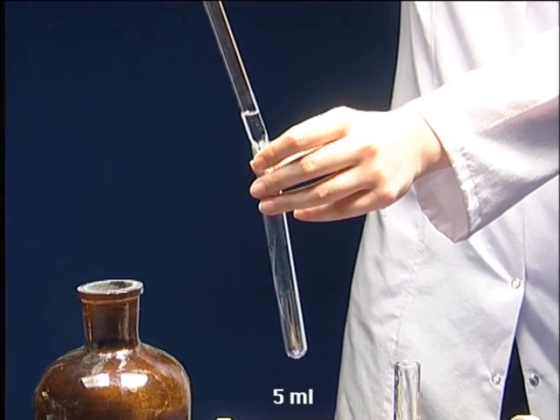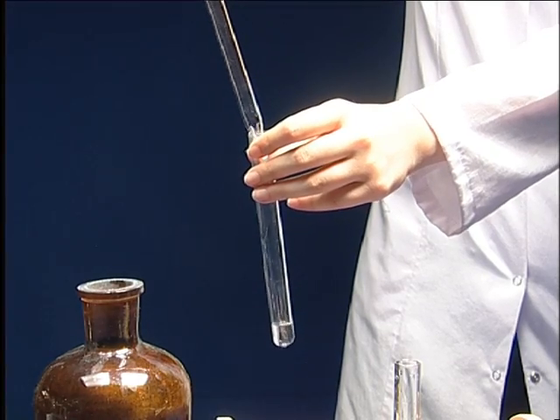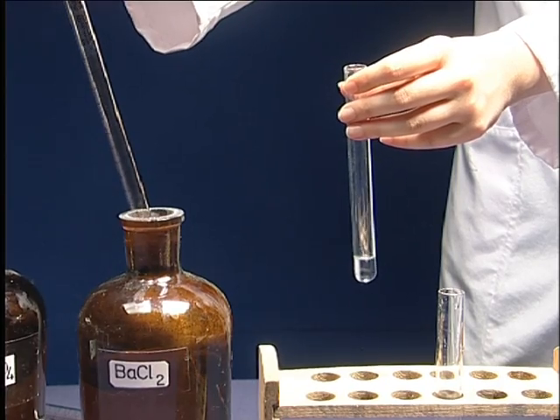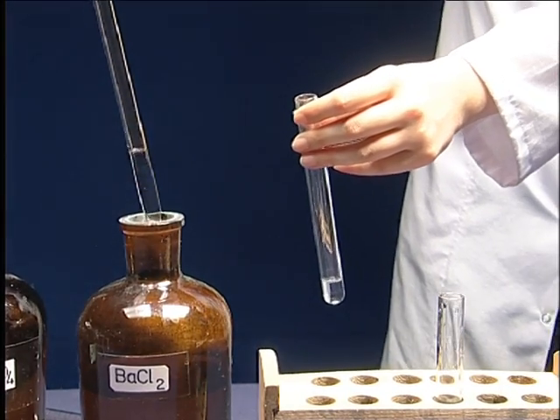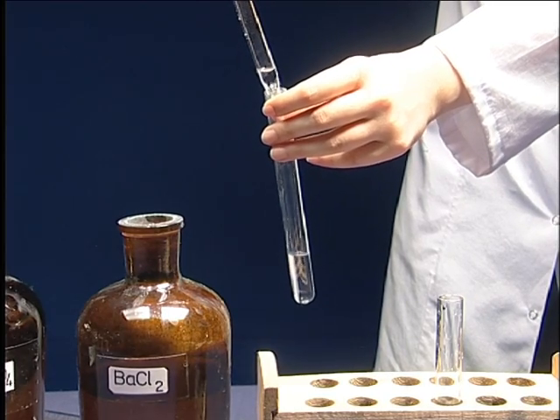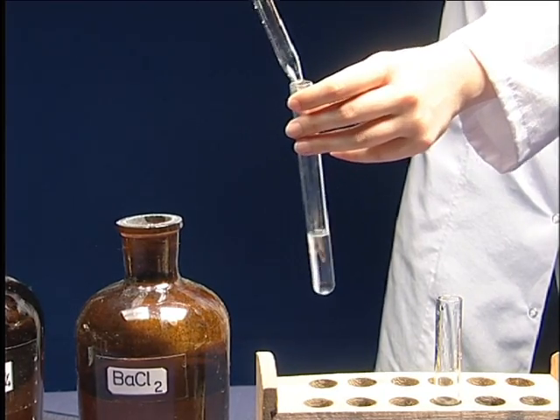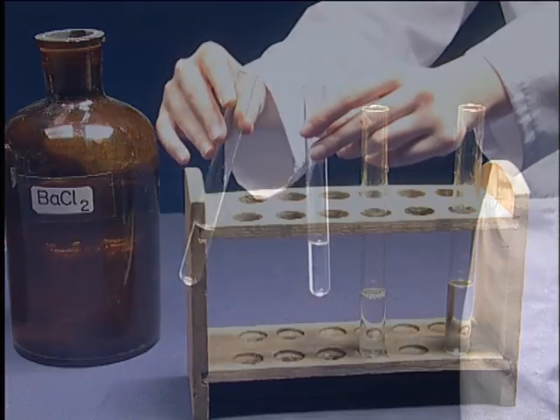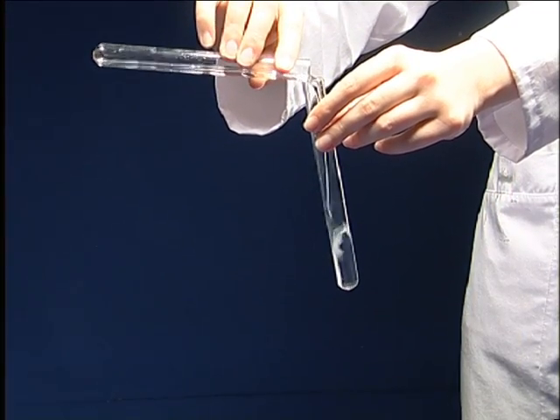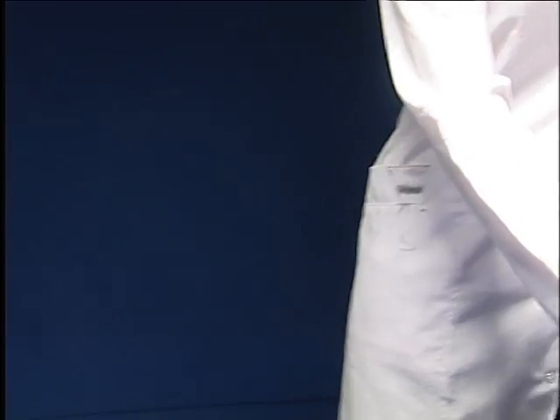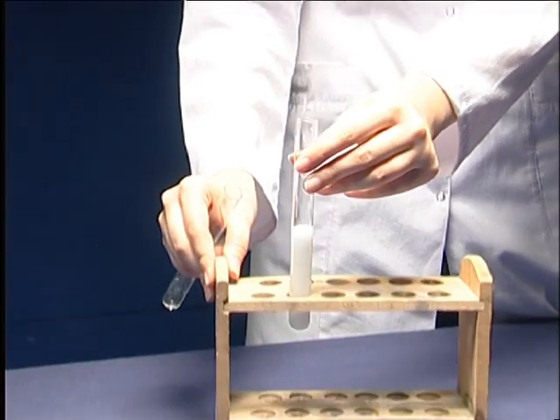Take 5ml of barium chloride solution and 5ml of dilute sulfuric acid solution. Mix them and observe what happens.